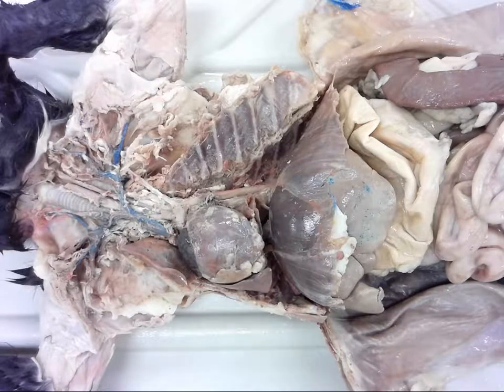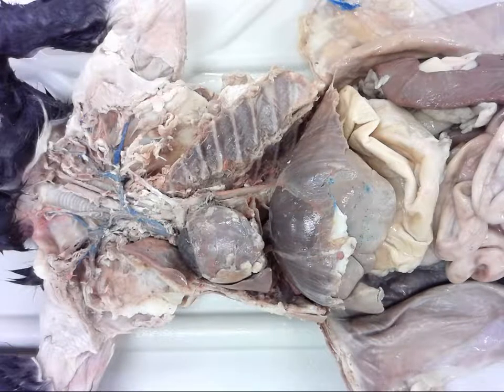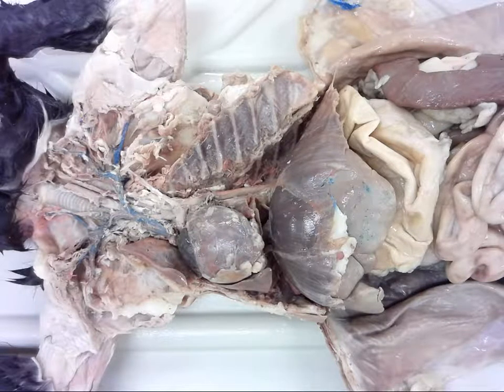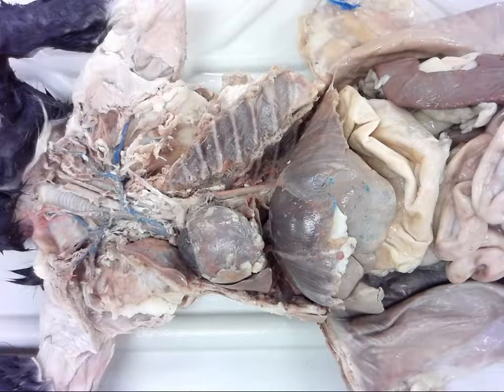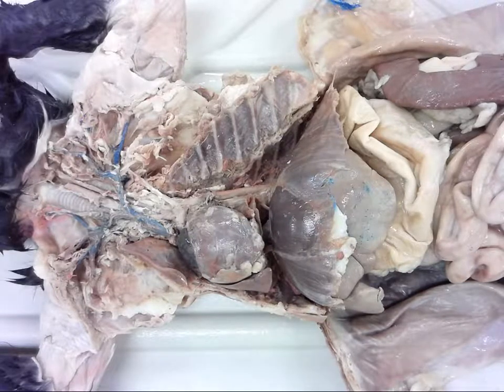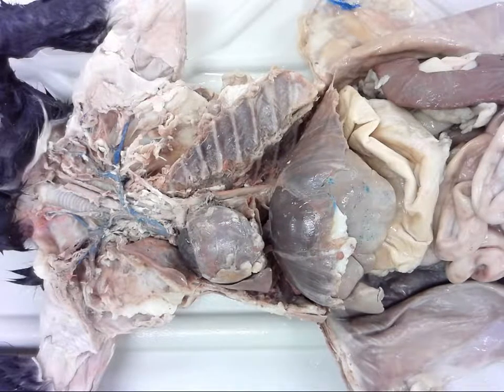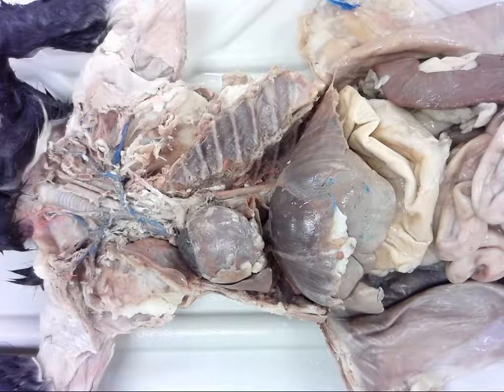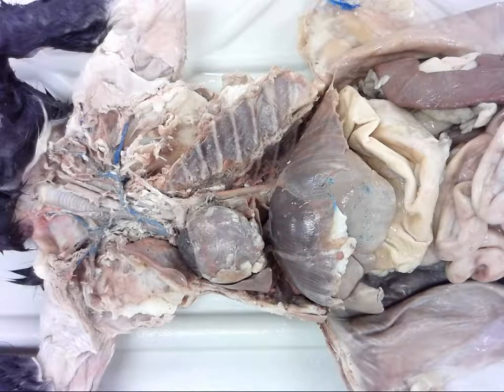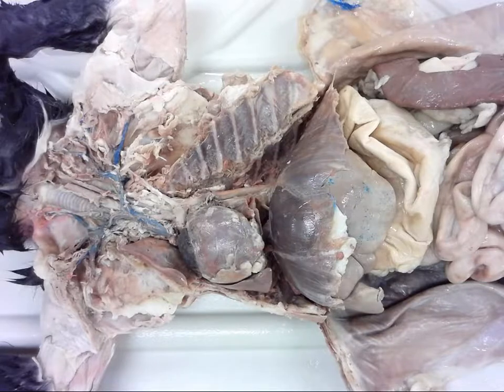Welcome class. This practice quiz video is going to be looking at the thoracic and abdominal cavities. We're going to be looking at anything from cardiovascular to digestive to urinary and reproductive. So anything on your structure list is fair game. There will be a couple more structures in this video than the muscular videos. I will try to get you a little better view of the different structures, so bear with my moving things around and zooming in and such.